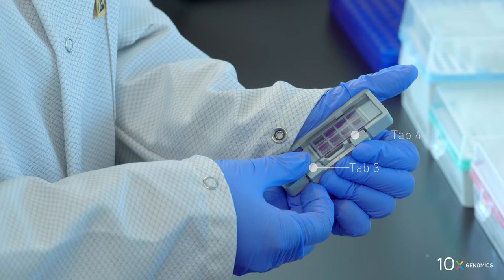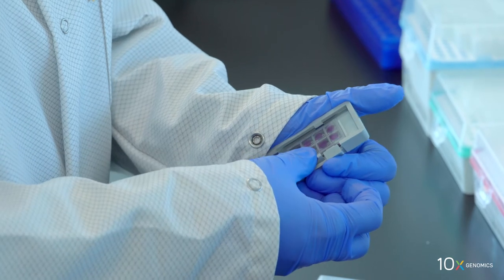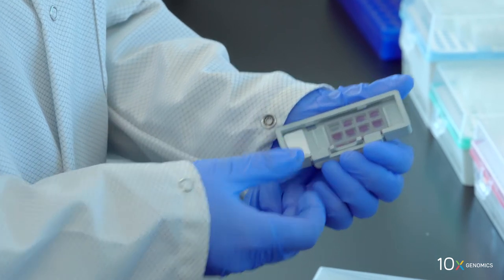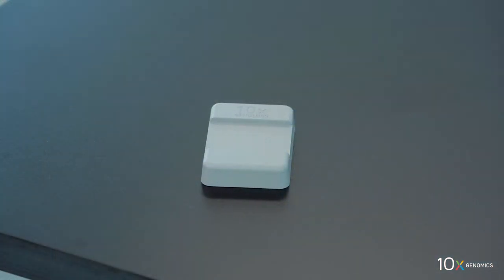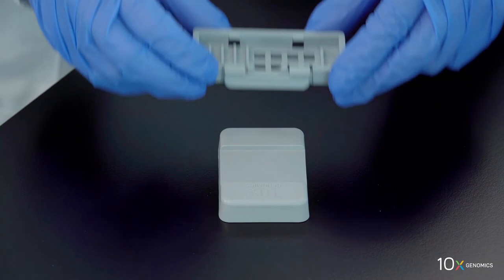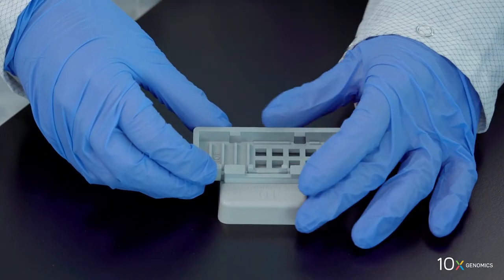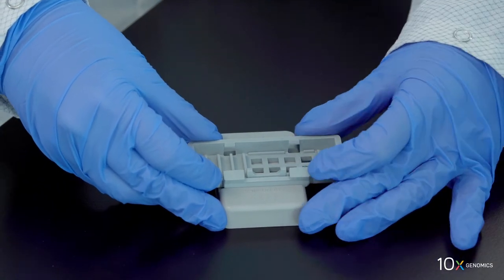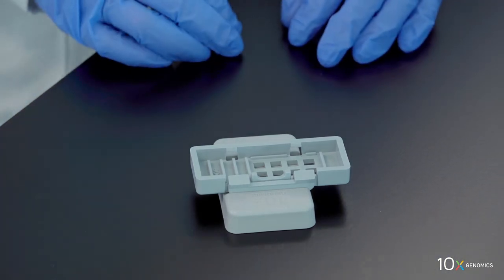Release the insert clip. The slide cassette can also be assembled using the slide alignment tool. Position the slide cassette along the alignment tool ridges. Push the insert clip along the ridge and press the slide cassette down. The slide cassette is now secured on the alignment tool.